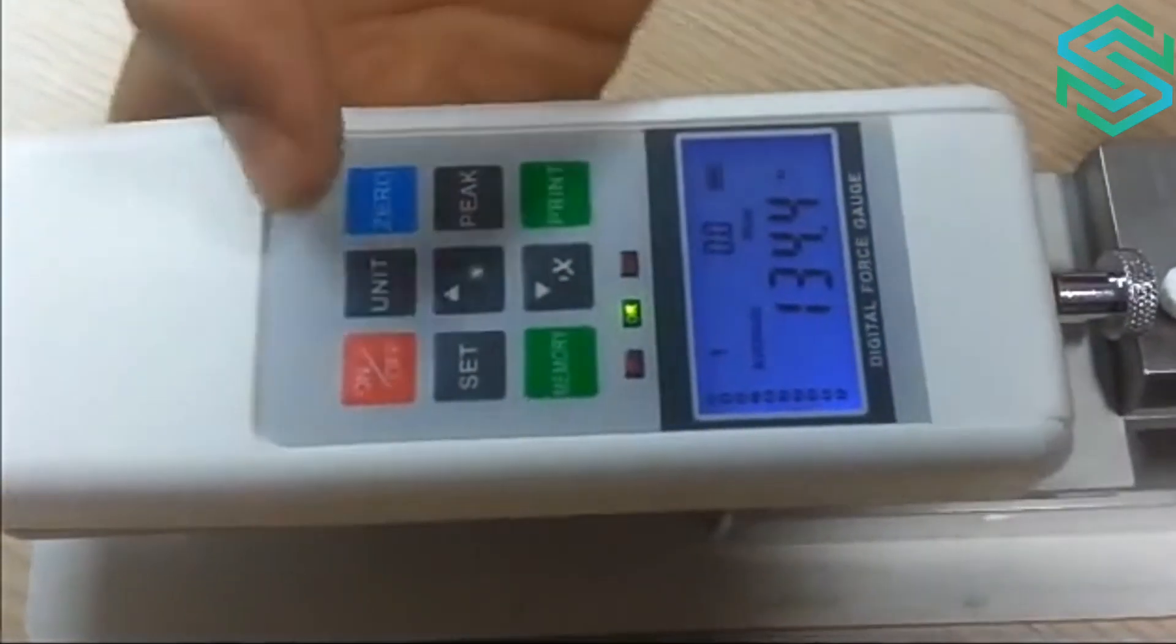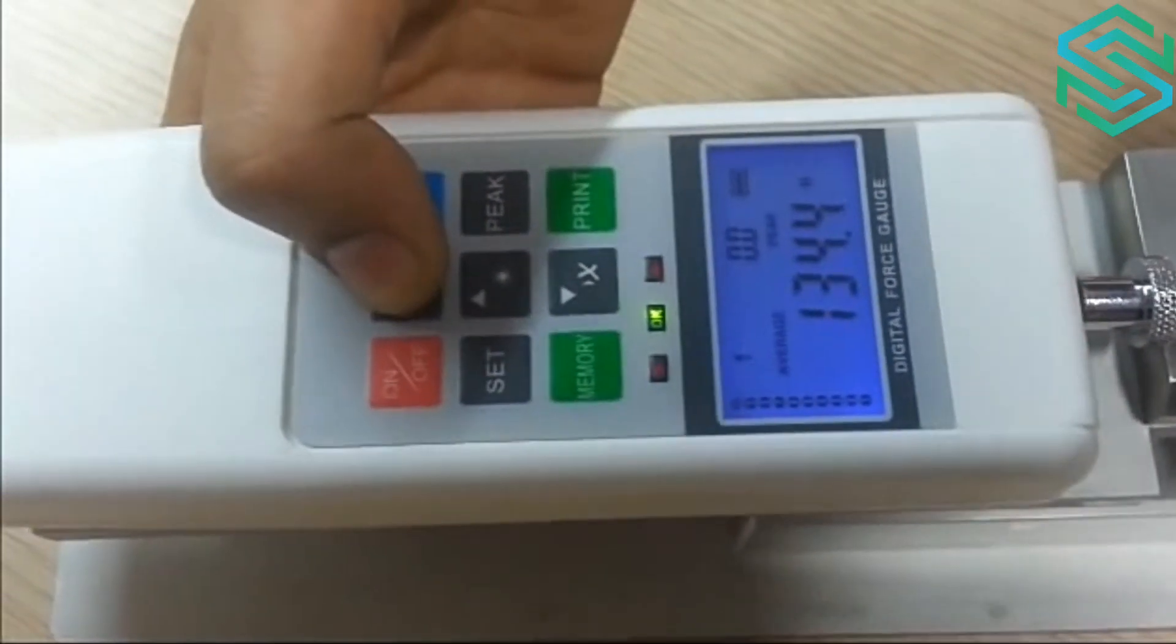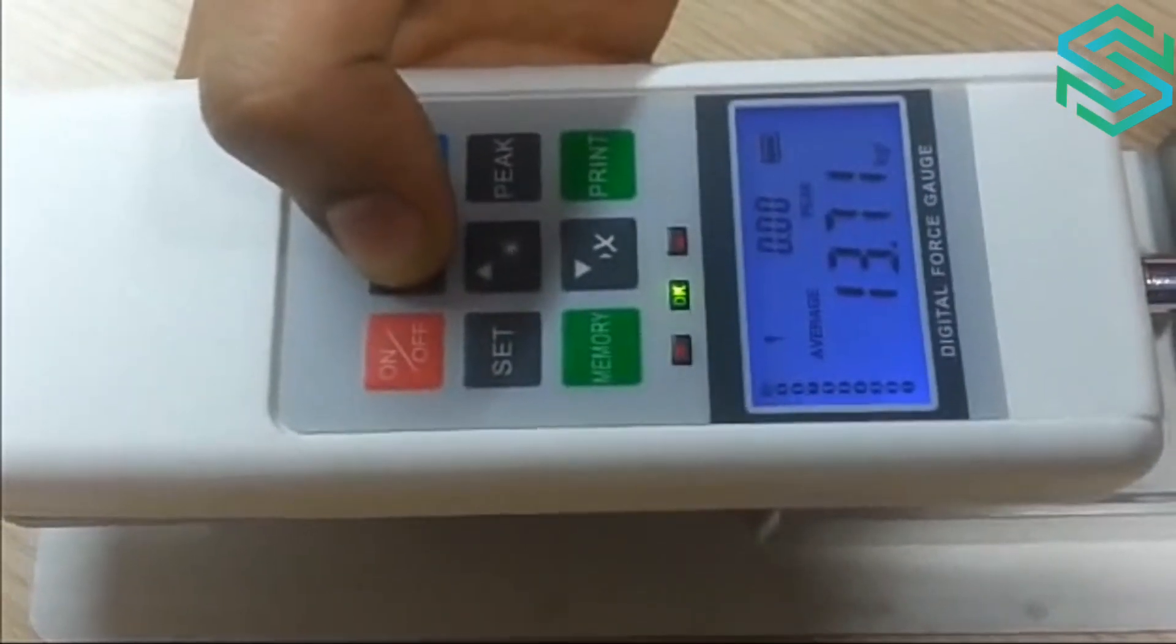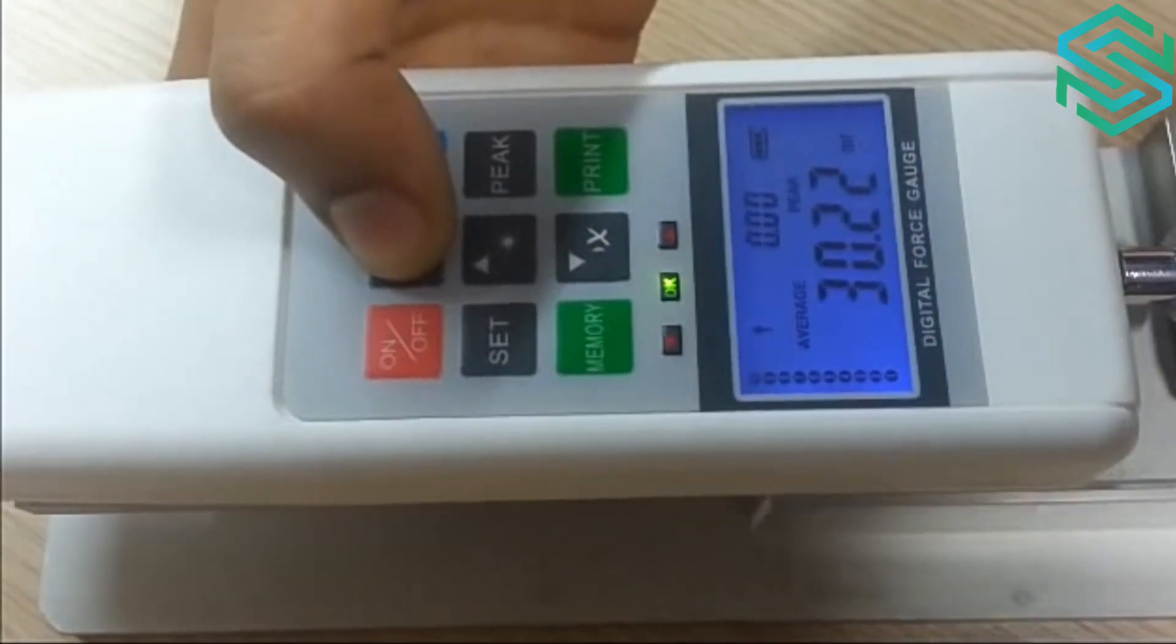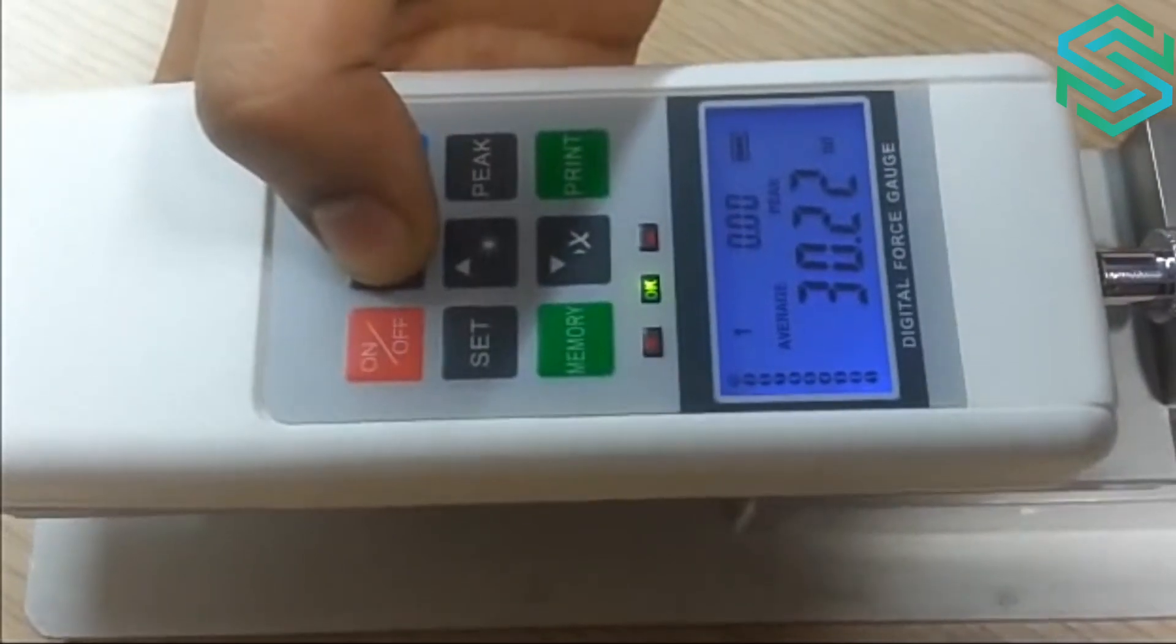You can also see the measurement in different parameters like in kgf at 13.71 and in Lbf at 30.22.